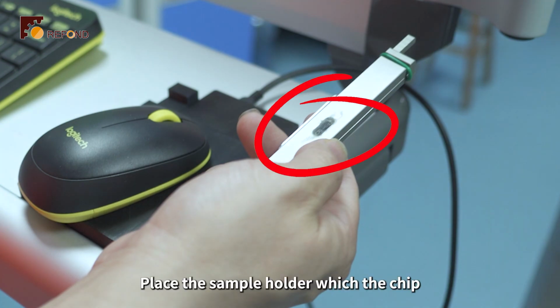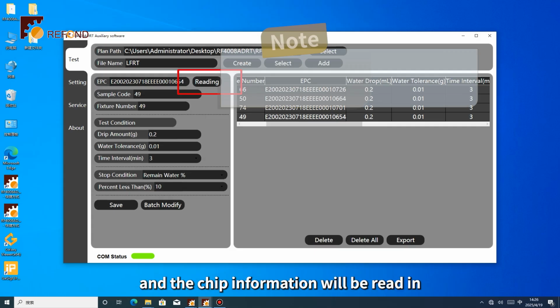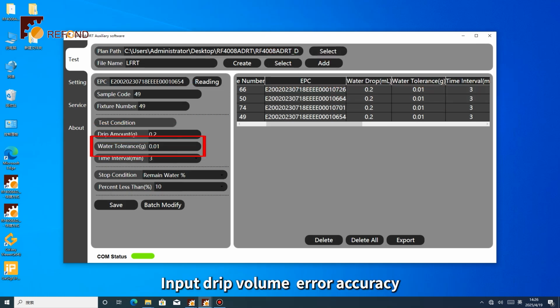Place the sample holder, with the chip on the top side of the card reader, click Reading, and the chip information will be read in. Enter the sample code. Input drip volume, error accuracy, time interval, and stopping conditions.